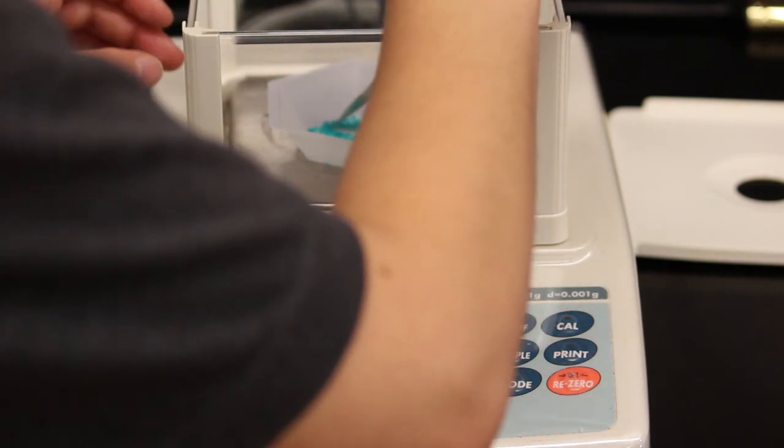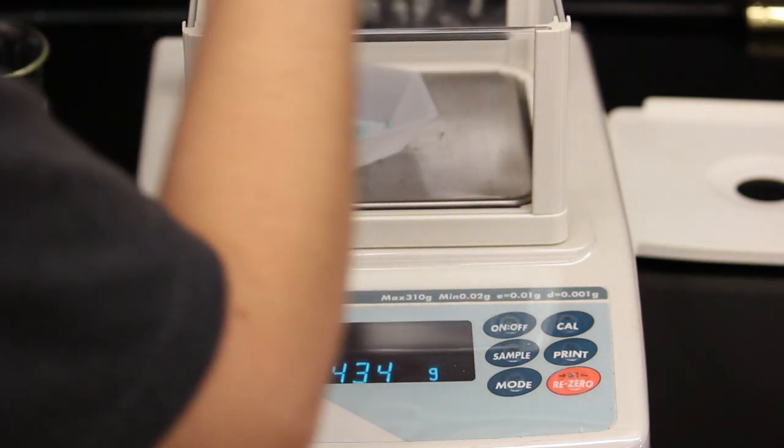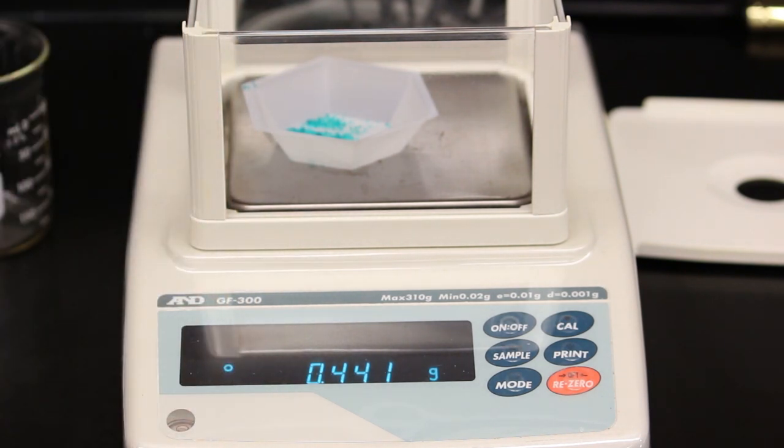If you add too much, you can remove the excess using the scoopula, but never return the compound to the stock bottle. This can cause contamination.